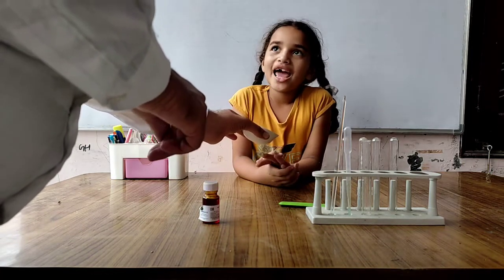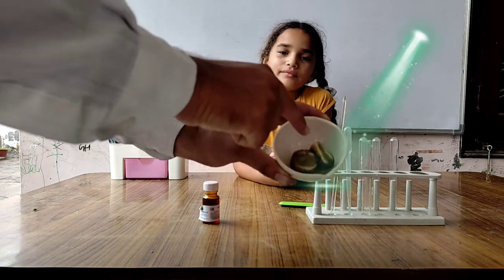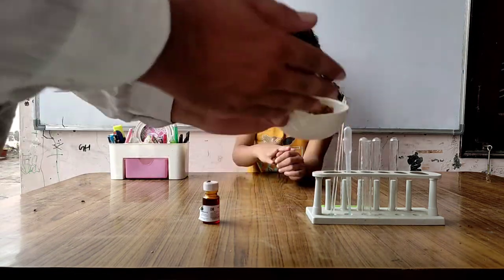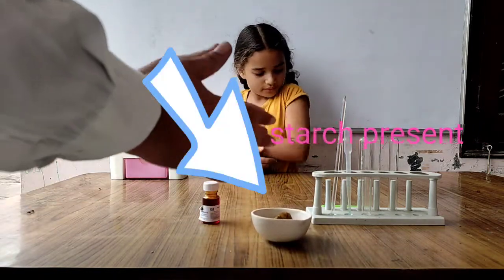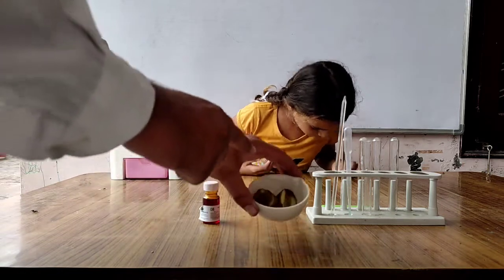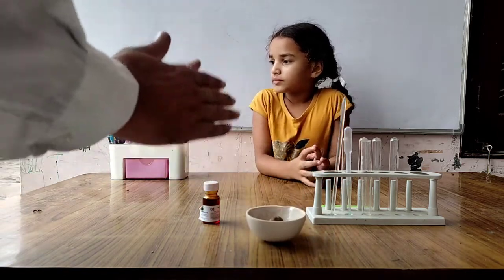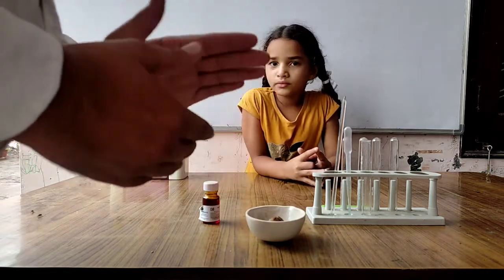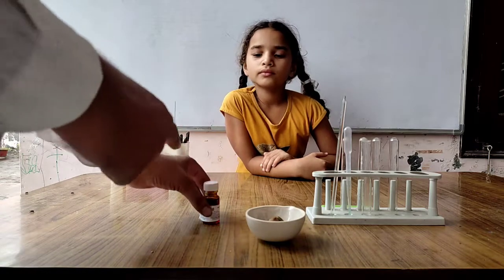Black. What is the color of the potatoes? The color of the potatoes has changed to black after adding iodine solution. So children, if the color changes to black, you can confirm starch is present. Just add a few drops of iodine solution on the food material.